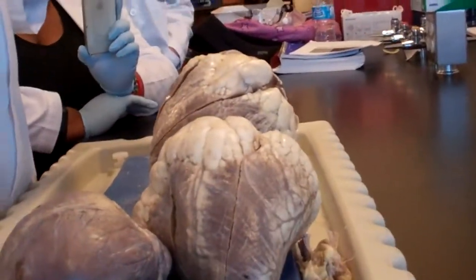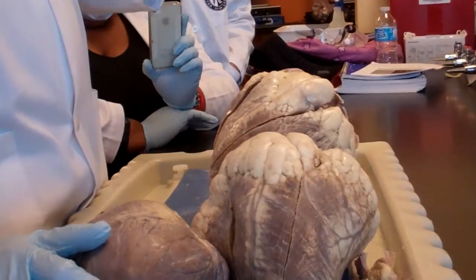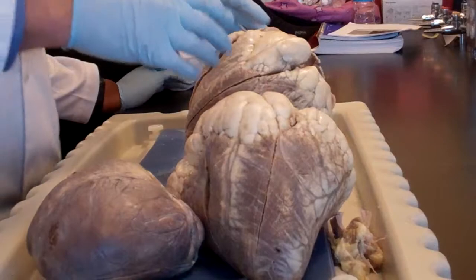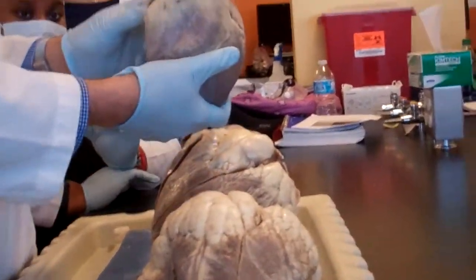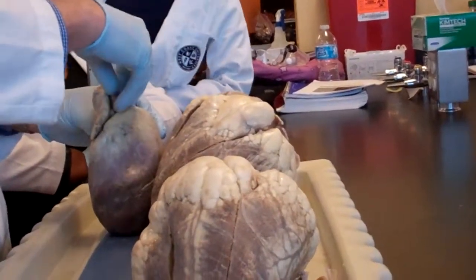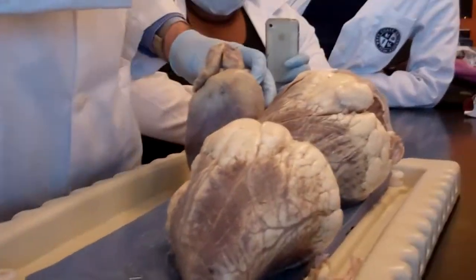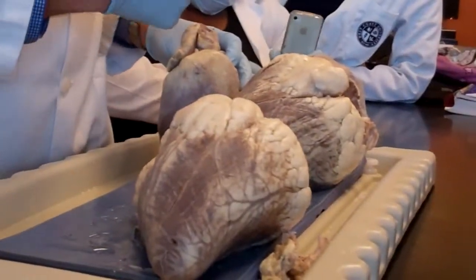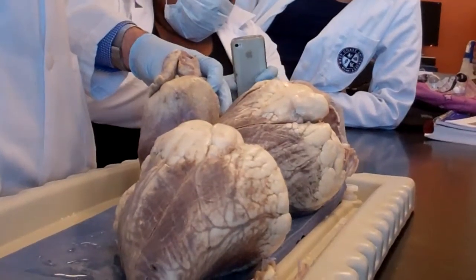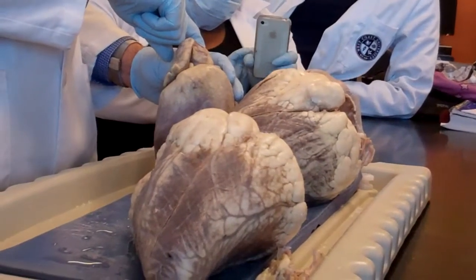On the left side, there are 2 separate openings for those vessels. It's the only exception in the body where the right side is not identical to the left side. That's all there is to know about that little concoction. And here are the 3 vessels right there. So this one here is a trunk, goes out to this side. But because it's a trunk, it's going to separate immediately into subclavian, right, and common carotid, right. Here is the common carotid, left, and here is the subclavian, left.